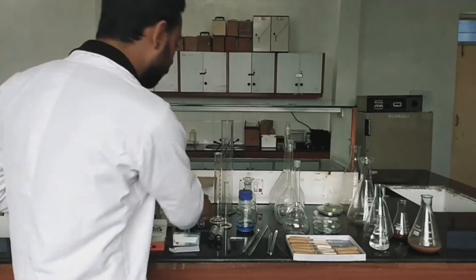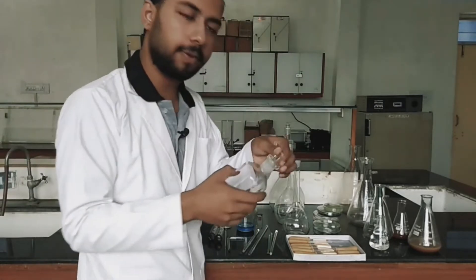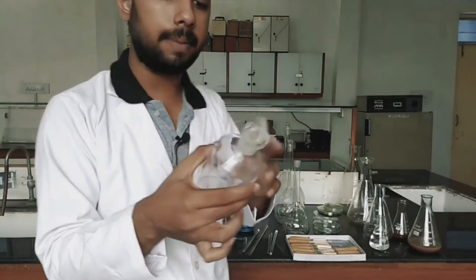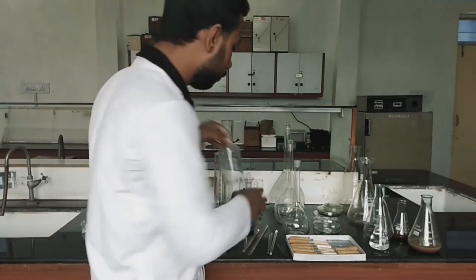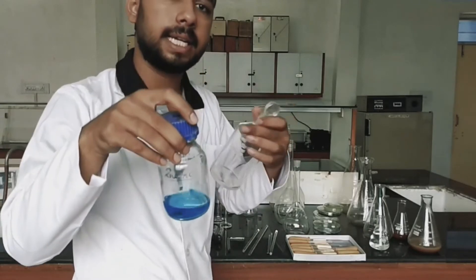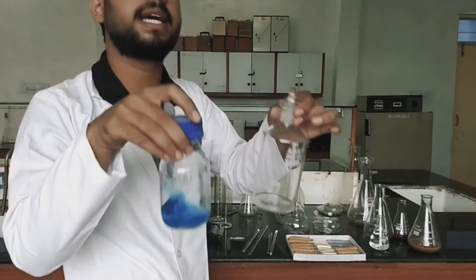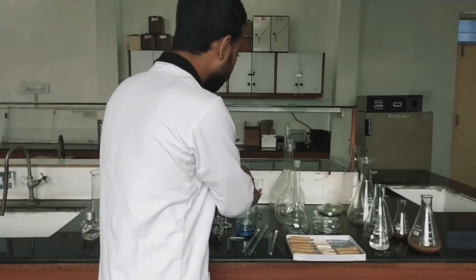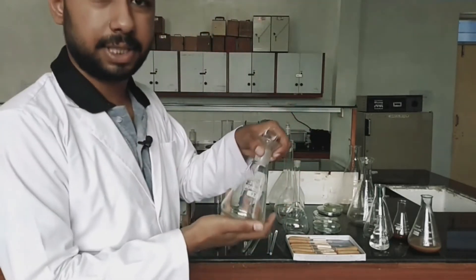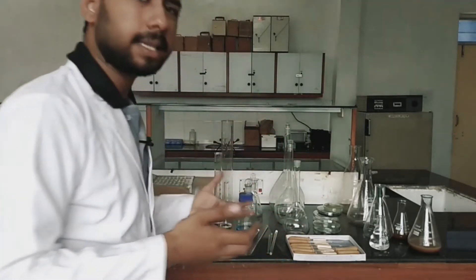Next, we are talking about reagent bottles. There are different reagent bottles, and they contain a cap on them. Reagent means we fill them with reagent solutions and chemicals that can react. These are used for chemical storing. They are also available in a conical shape, and we can store anything in them.